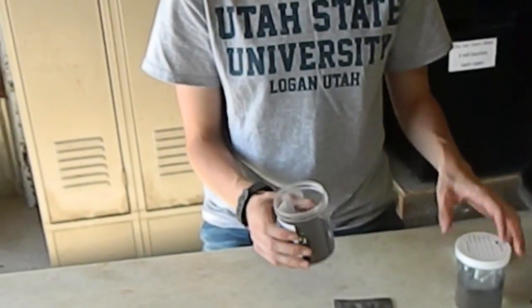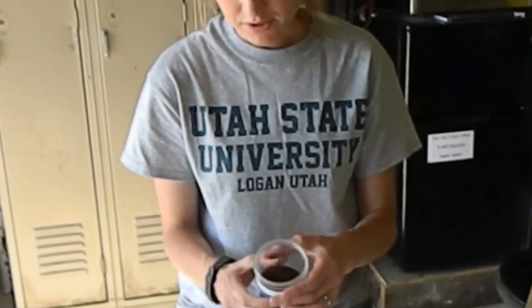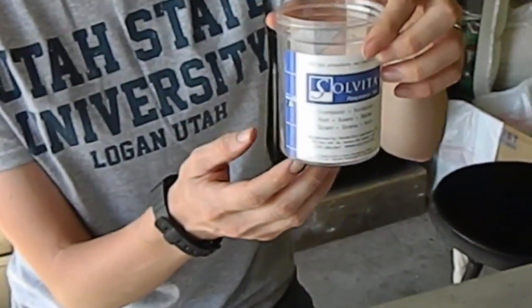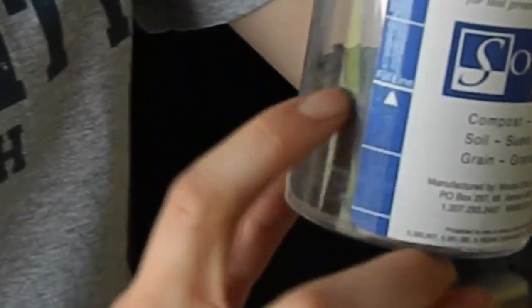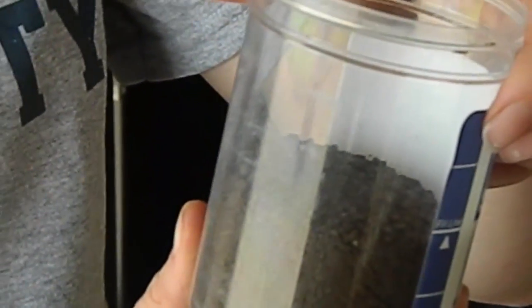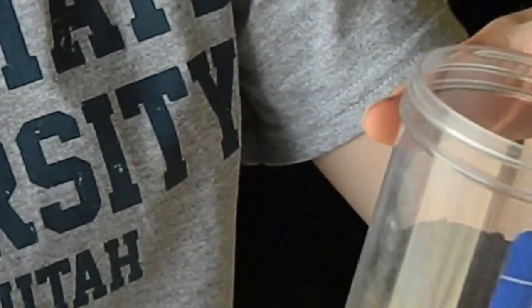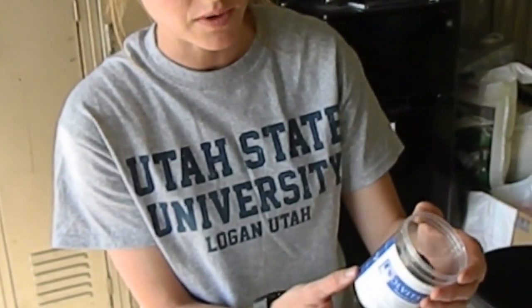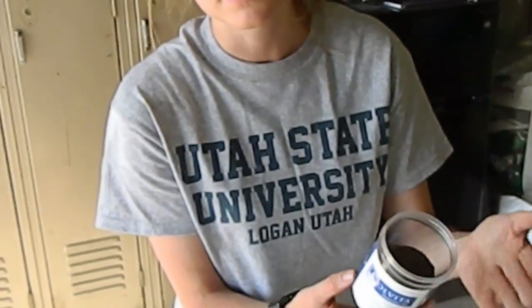Here's how you do these: you fill the little cups with soil from the management plot you want to test, up to the line. You don't need to sieve it. It's best if you can take out large roots and rocks — take out as much as you can. The instructions don't say to sieve the soil.